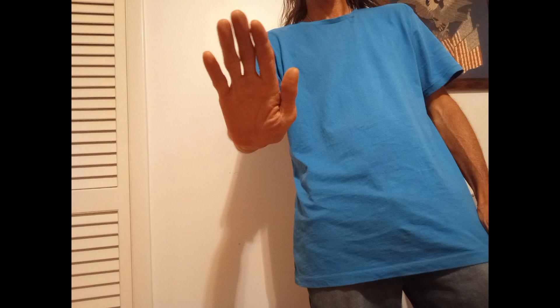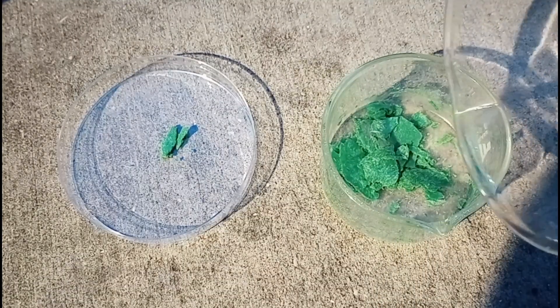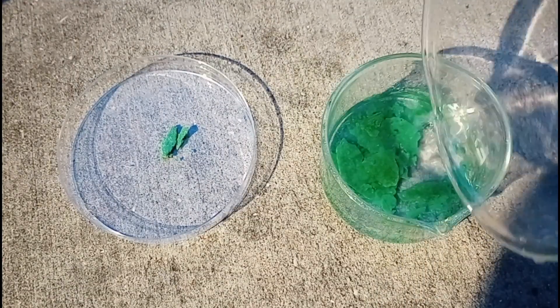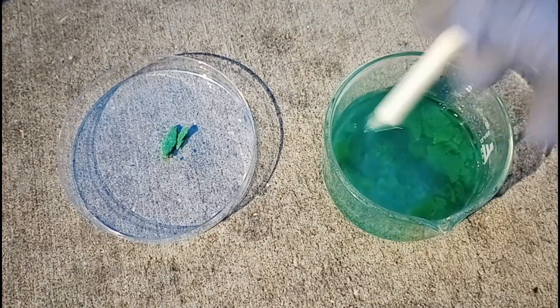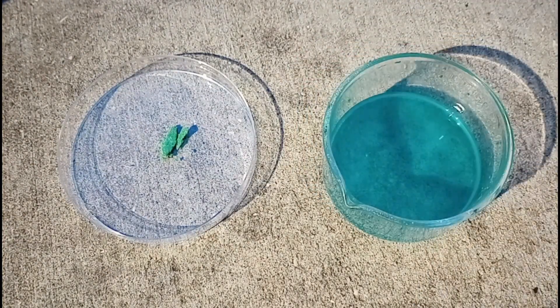Why are you all about crystals now? Crystals are usually an indication that you have a pure substance. In this case, copper chloride. And, the more pure the substance, the better crystals you get.